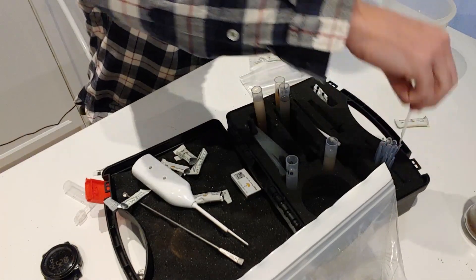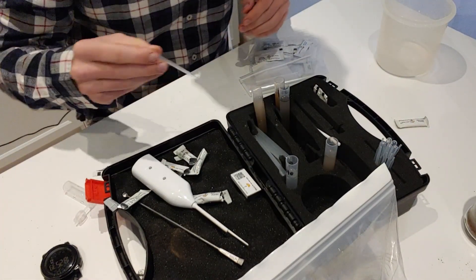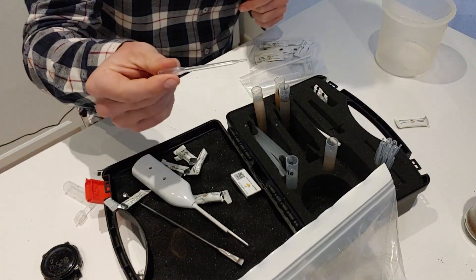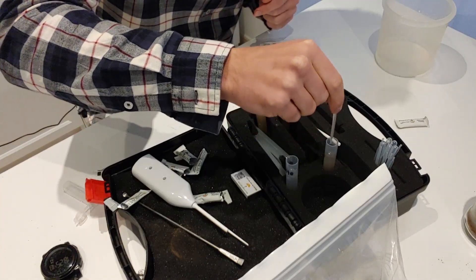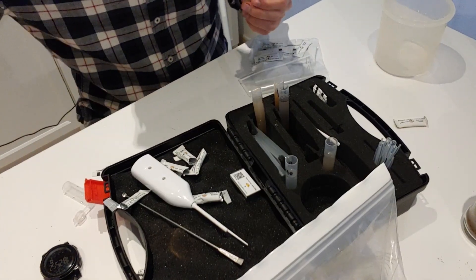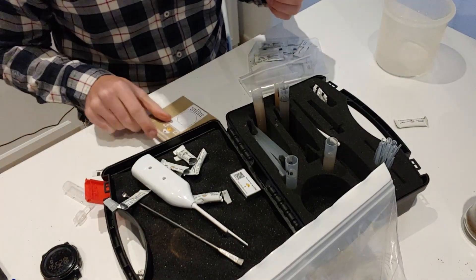Now 20 minutes has passed, and in that time I've gone ahead and done some of the other soil samples — I've got them standing here, but this is our original one. With the little given droppers, I'm going to take this sample and put three drops on the little test pads, which I'll then place on top to get our results.